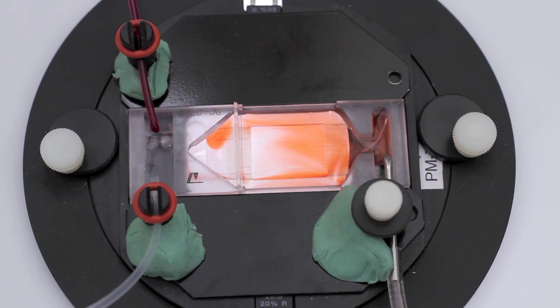Observe the use of a cotton wick bridging the bath and suction well, allowing for smooth movement of solution into the suction well. This can minimize any tidal action in the bath. When a wick is used between the bath and suction well, we recommend the use of cotton gauze or suture thread.